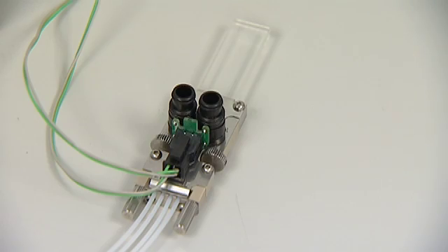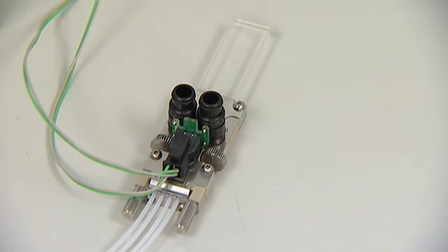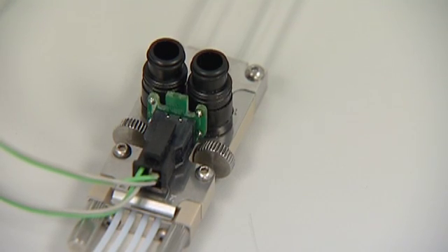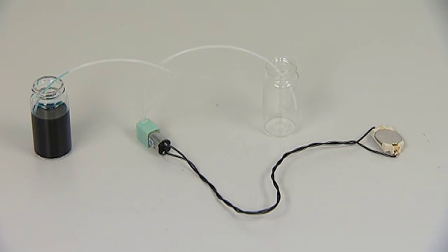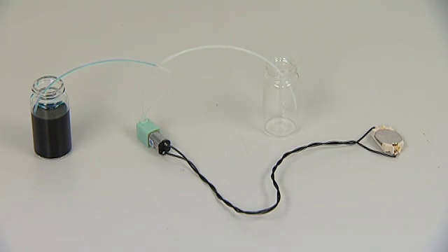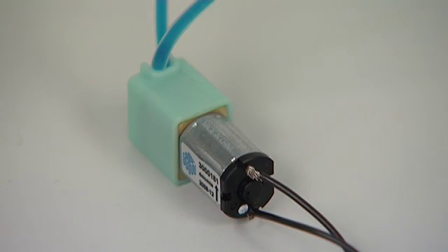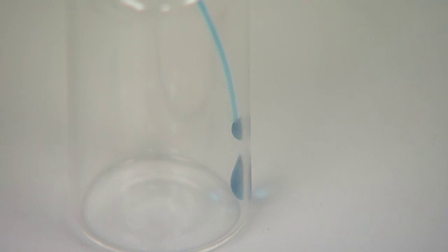If you need low power consumption and small size, then electro-osmotic pumps are ideal, delivering smooth flow and pressures up to 20 bar. Finally, our miniature peristaltic pump offers a low-cost compact solution which can work for many hours from a single battery.